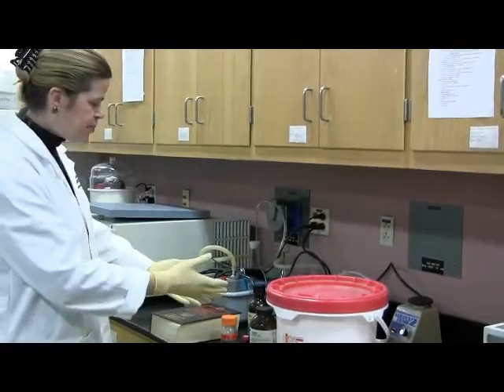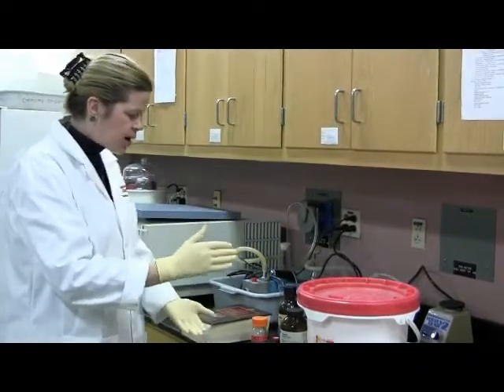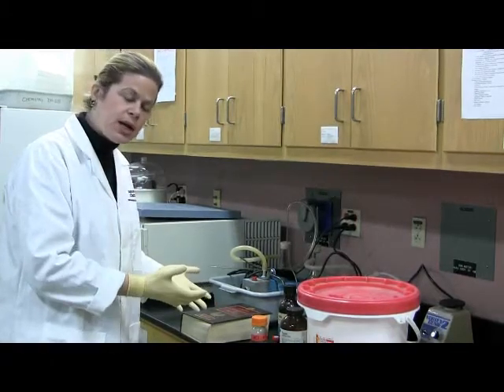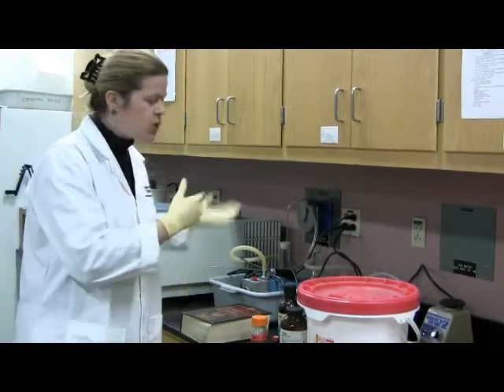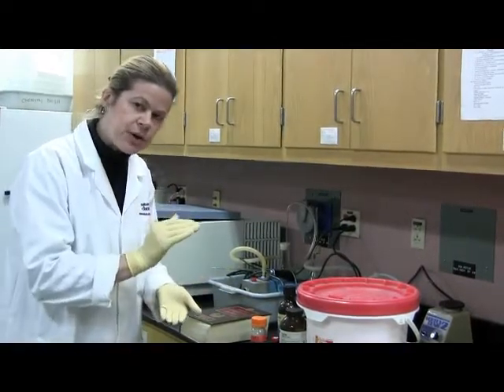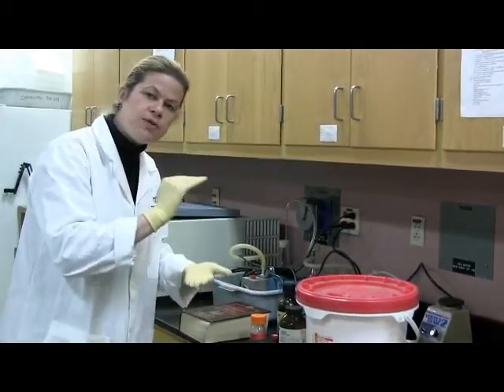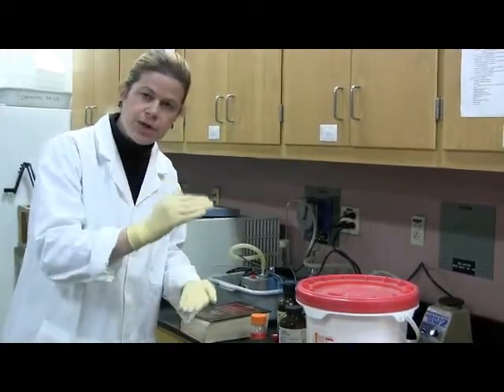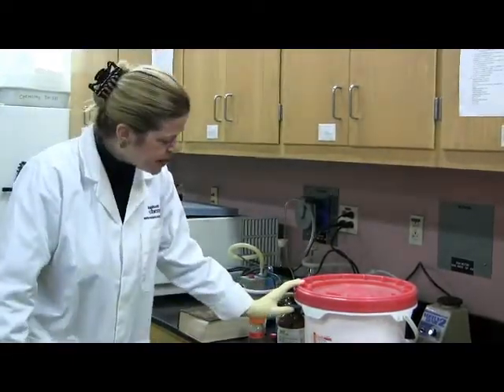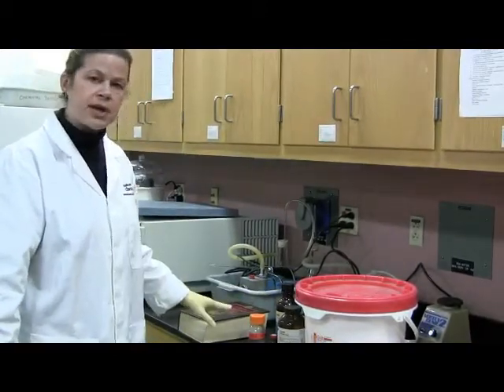Right, so what you do is you take that buffer, that you make, that Tris dissolved in the water, and then you're going to add HCl to it until it becomes the pH that you want, right? When that happens, then you add the calcium chloride that is necessary for that 500 mils of buffer, and then you finish by putting the water up to the 500 mils that you designed your buffer to be, okay? So you can do that, and this is an important skill, making buffers, so you need to do that, and it's important that the pH be accurate.